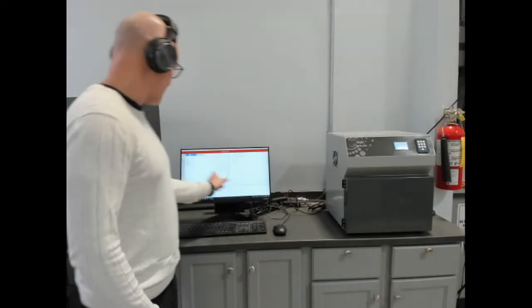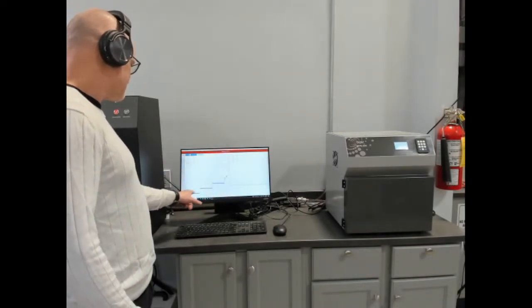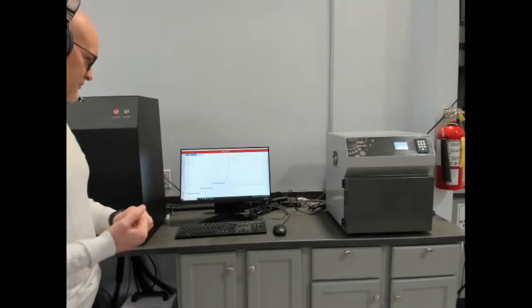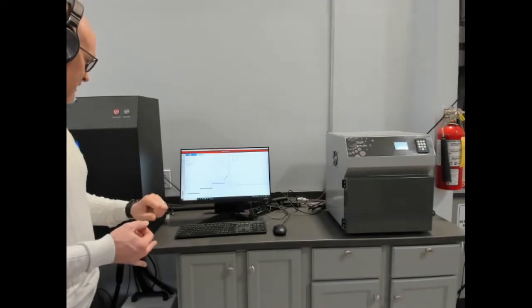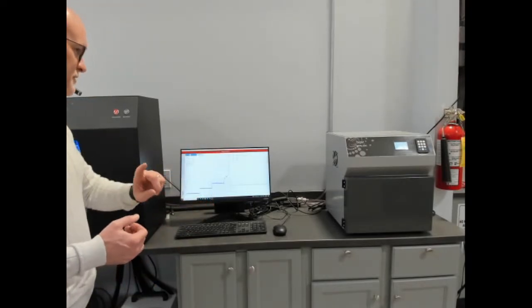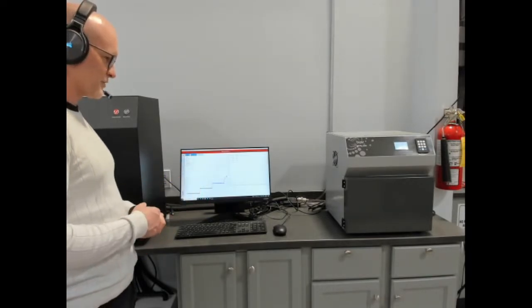Right now we're actually measuring, I would open the door and show you, but right now we're measuring specific heat. To expand the ranges on the heat flow meter, we can go up to 2.5 watts per meter Kelvin with an extended range thermal conductivity kit, and then we have a specific heat module. So there's actually a measurement being done right here, measuring the specific heat of the sample inside it. And once you know conductivity and specific heat, you can calculate thermal diffusivity as well.